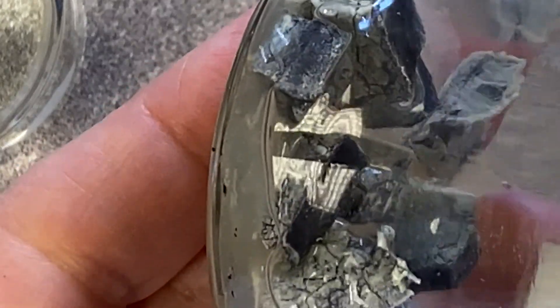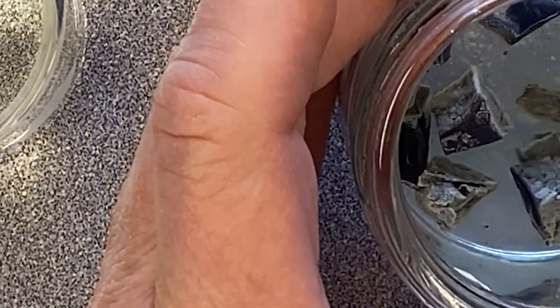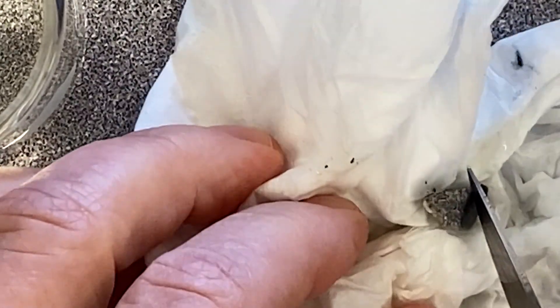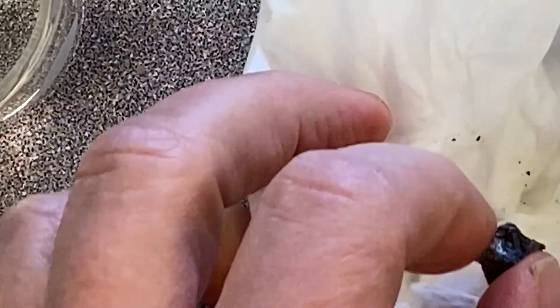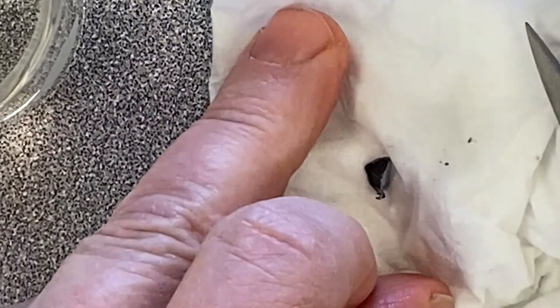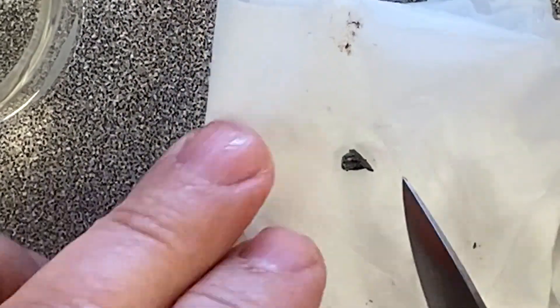Here's our potassium. We see that it looks solid, silver-gray, but some parts look also black. It is also stored in oil, so I don't need much — just a tiny little bit. It's very soft, so I will cut this into just a tiny little piece. That's all we need.